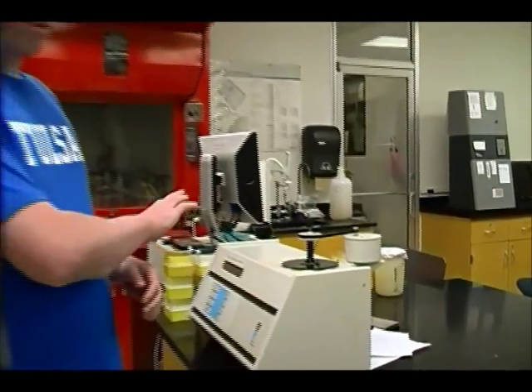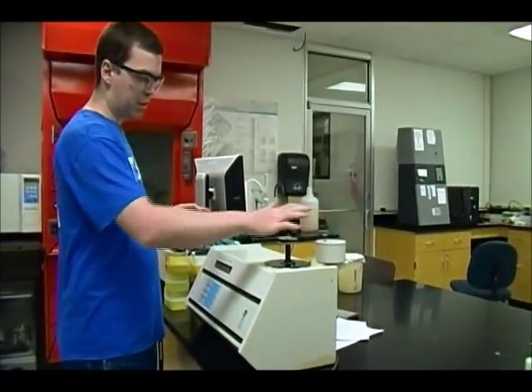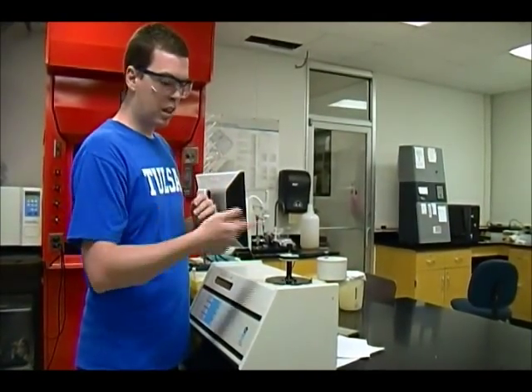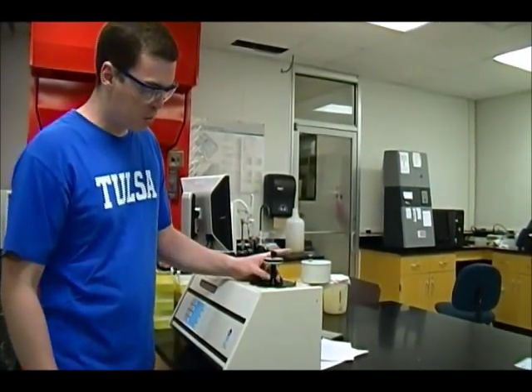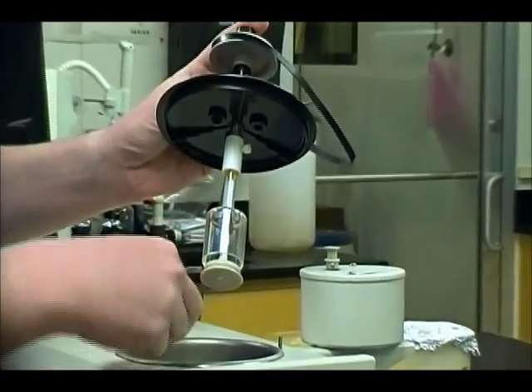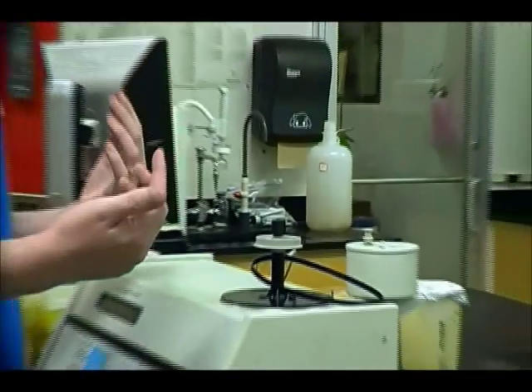Once you get all the codes put in, it will automatically start the motor and it will start spinning. After a little while, the system will beep indicating that thermal equilibrium has been reached. At that point, you're going to do something I like to call bopping the top of the system — bopping this glass rod. It's important that you get just the right amount of force. If you don't put enough force, you won't release the mechanism for the compound to get out into the solution, so you won't have a complete reaction. If you hit it too hard, you might break the glass rod. So I like to call it just a swift pop on the top. When you do that, the Teflon dish is now completely out of the bell, all the liquid in the Dewar gets into it, it reacts with the compound, and the thermal change takes place.